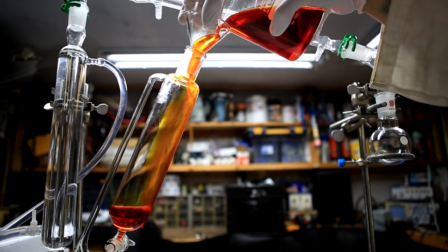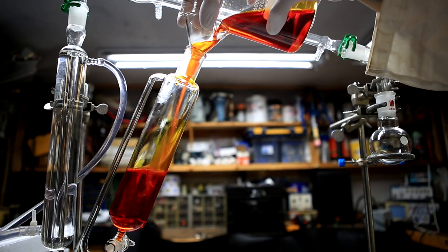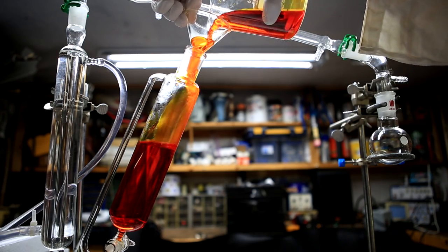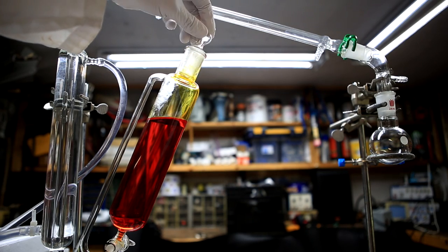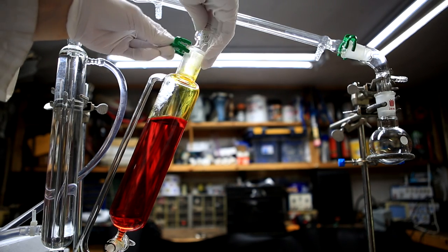To one of the necks is added an addition funnel and to this is poured in the chromic acid solution that we made earlier. The addition funnel was then stoppered and held in place using a Keck clip.